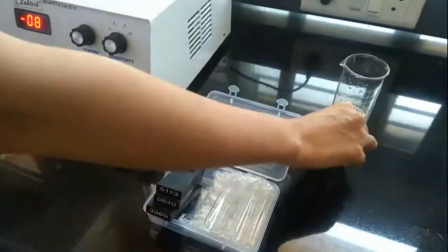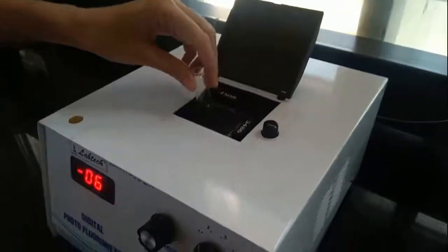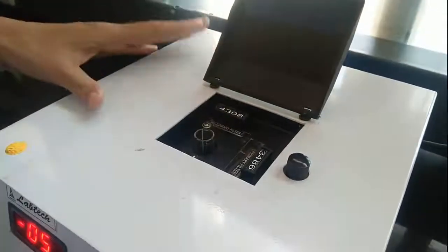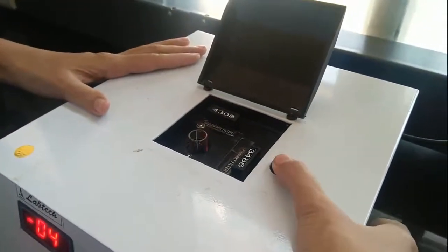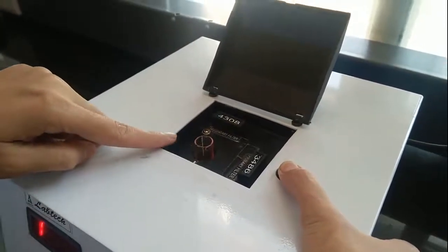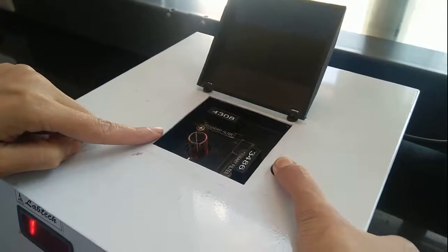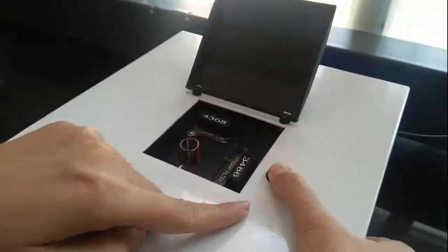This is the sample holder and we are going to place it here in this fashion. Whenever we record the readings we have to press this button — when we press this button the light passes through the sample holder. During taking the reading we have to keep this button in the pressed mode.